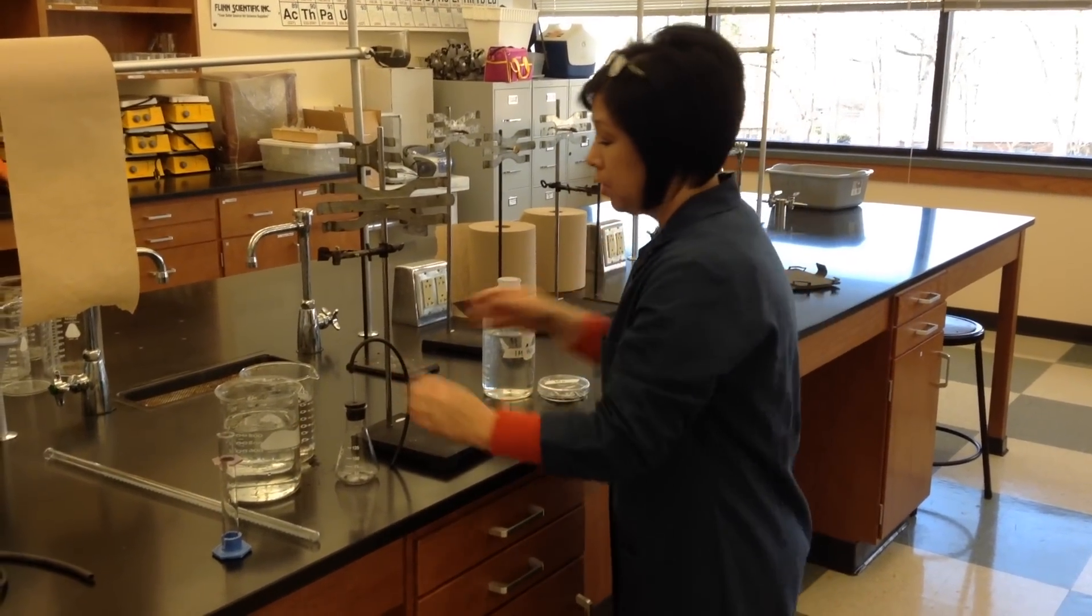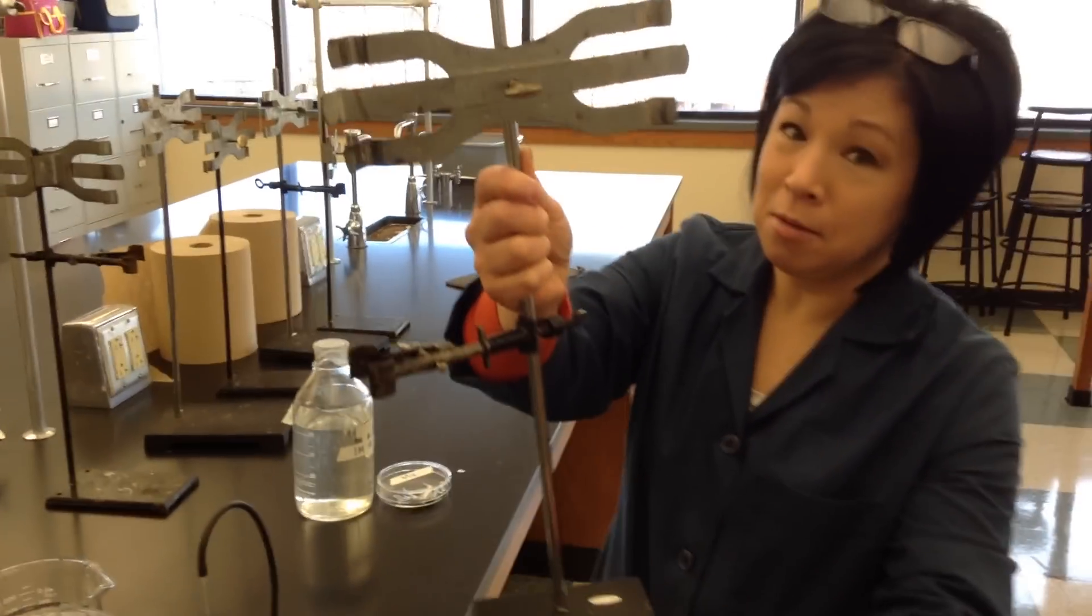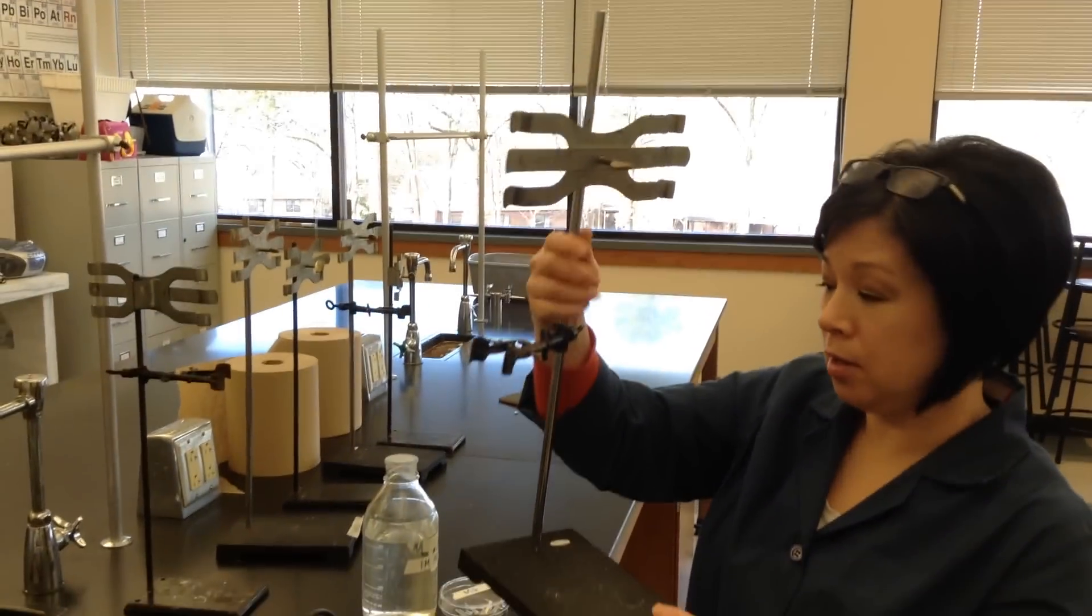So this is one way to do it. Here's our setup. It's easiest if you have a ring stand with a burette clamp and a utility clamp.